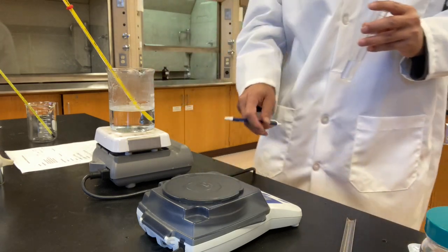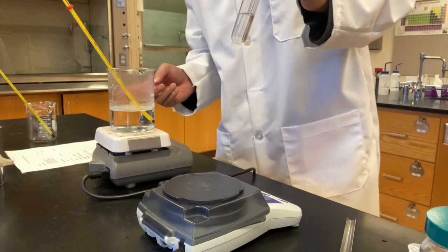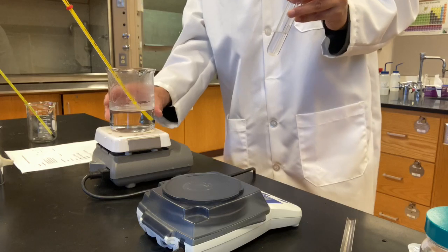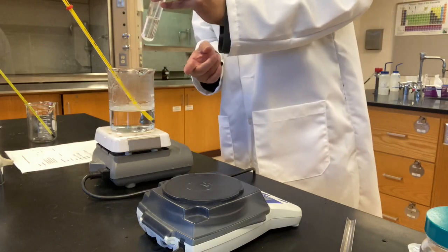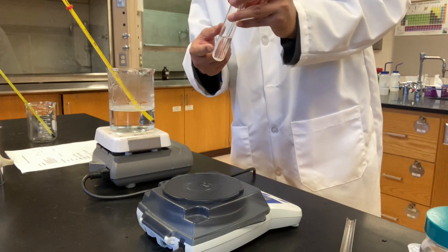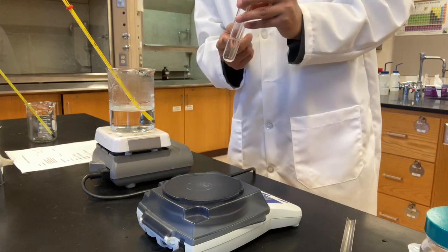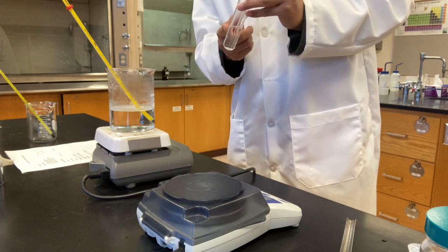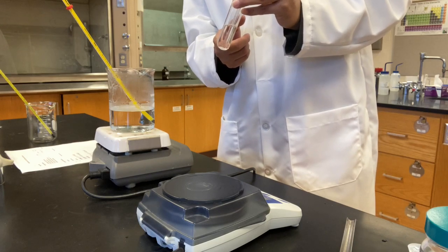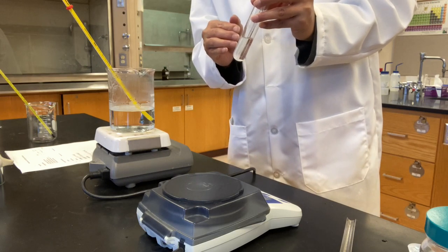Okay, let's do the next part of this experiment. I'm going to raise the temperature of the hot plate, the water bath, put it in it, and try to dissolve all the potassium nitrate in it. Then I'm going to bring it out, cool it down, and observe first at what temperature the crystal will come out. Okay, when temperature goes lower, solubility decreases.